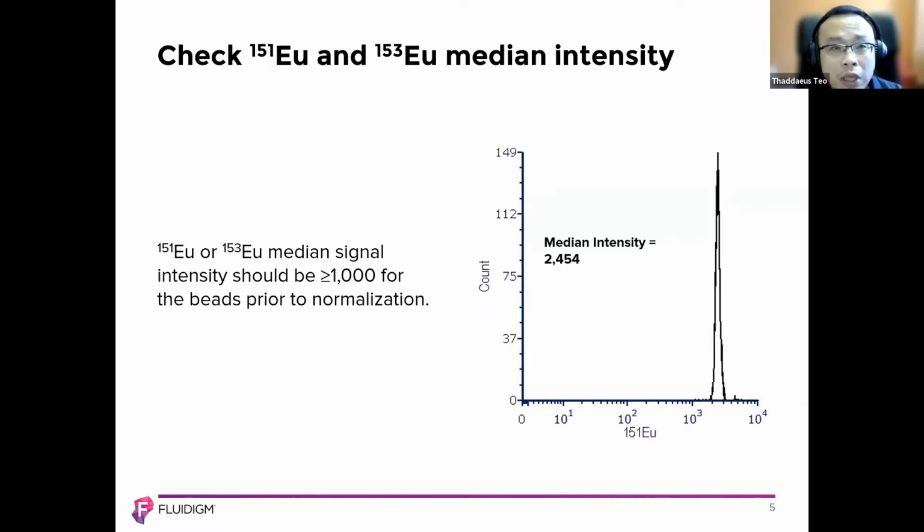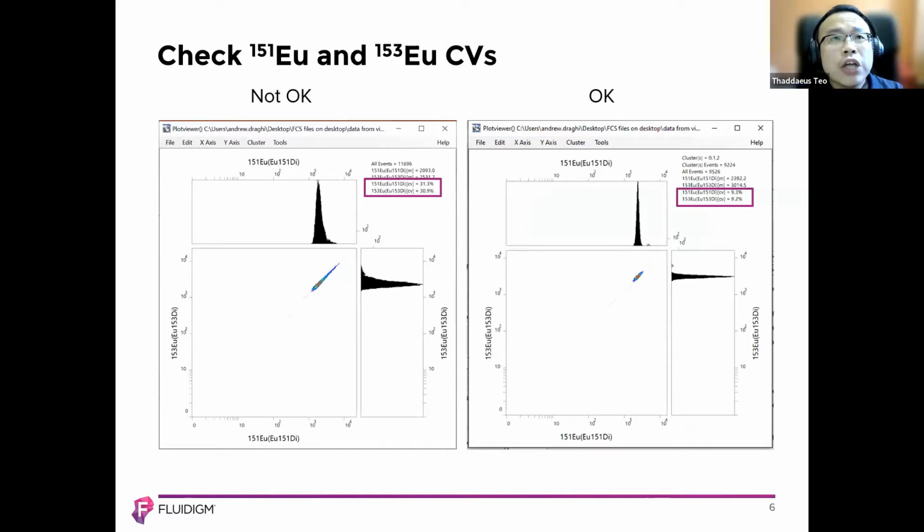If it's lower than 1000, please look at your system. You might need to do a bit of a wash on the front end to make sure everything is in order. It might be a bit dirty, so you just clean it up and it should be ready for your sample run. Now let's check the CVs, right, for 151 and 153.